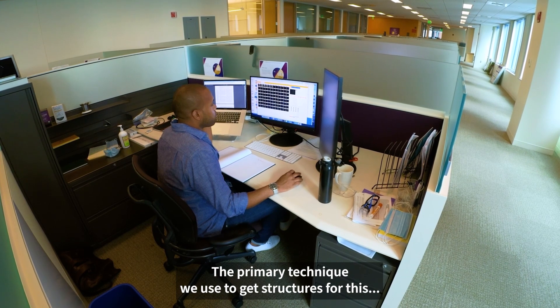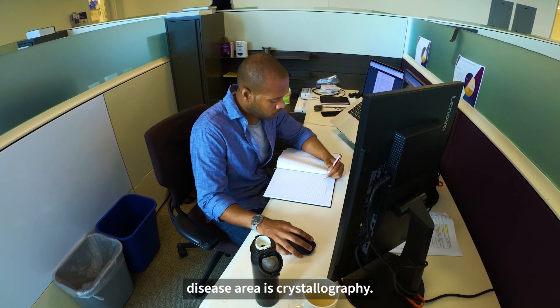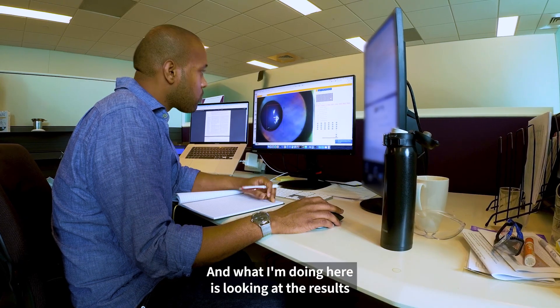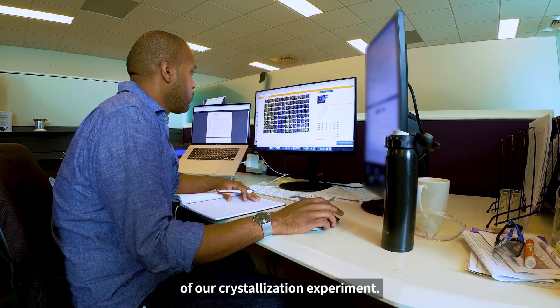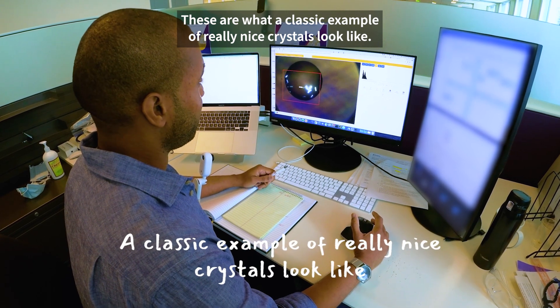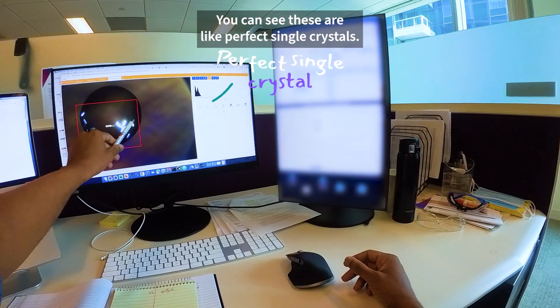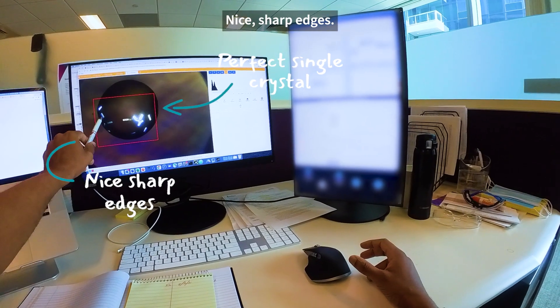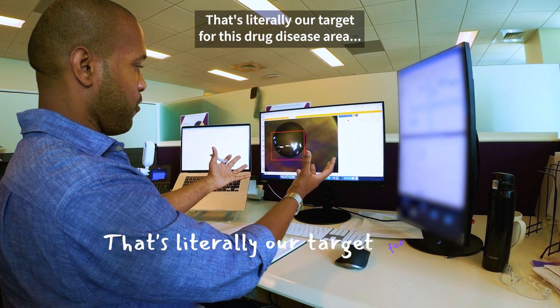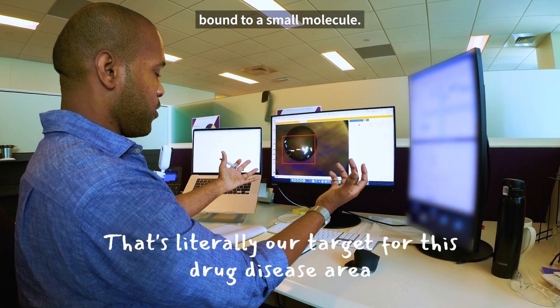The primary technique we use to get structures for this disease area is crystallography, and what I'm doing here is looking at the results of our crystallization experiment. These are what the classic example of really nice crystals look like — perfect single crystals, nice sharp edges. That's literally our target for this drug disease area bound to a small molecule.